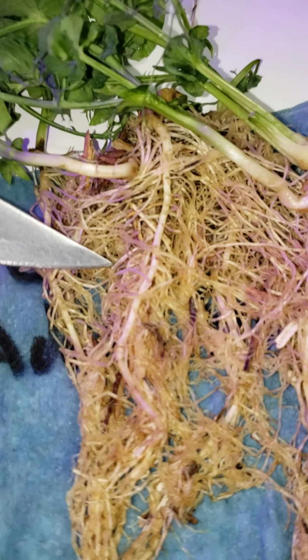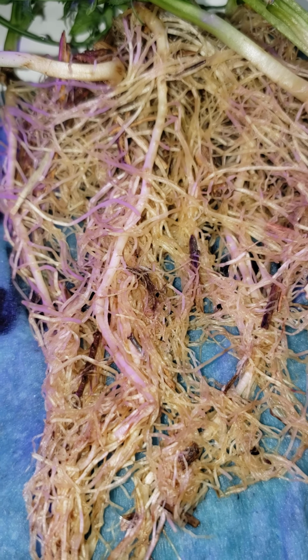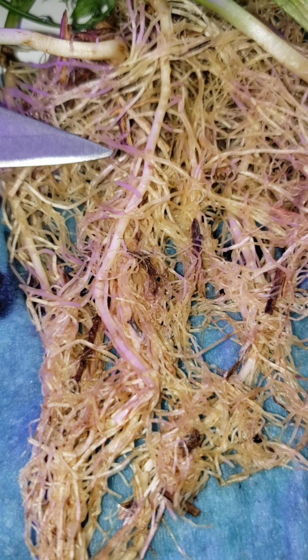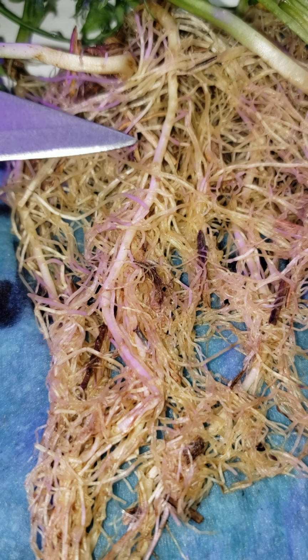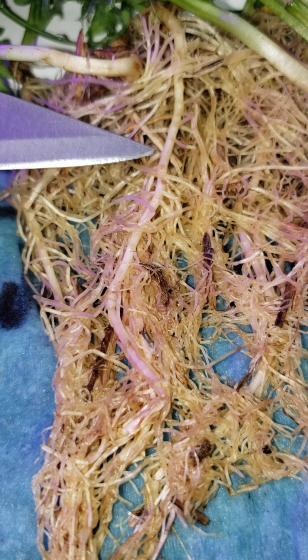If we move over to the treatment here, where we have lots of available nitrogen in the soil, 200 milligrams of N per kilogram added, what happens there essentially is the plant says, hey, there's lots of available nitrogen in this soil. I don't need those rhizobium and the nodules. I don't need to give them any food. So the plant just uses the available nitrogen in the soil. The nodules don't develop. The pea plant does fine, but we don't benefit from the added nitrogen that comes from the nitrogen fixation from the air via the rhizobium in the nodule.